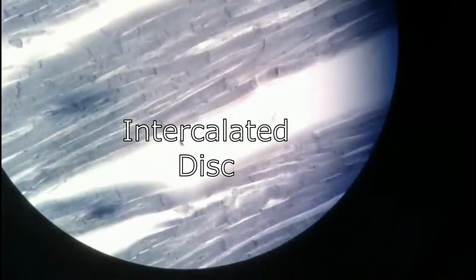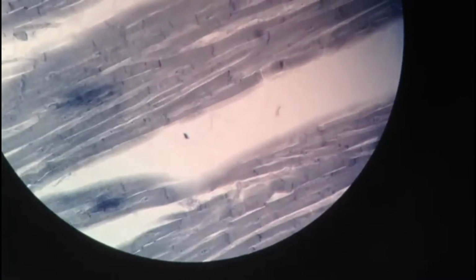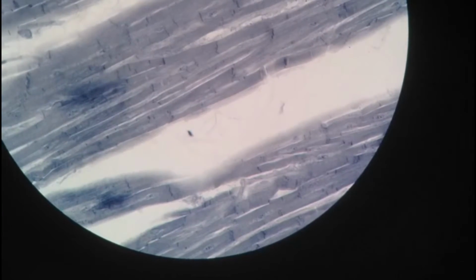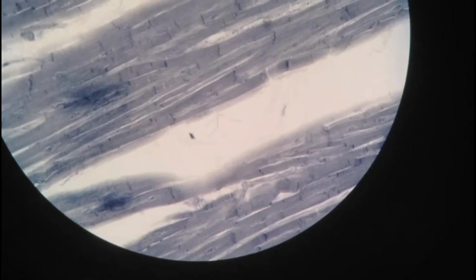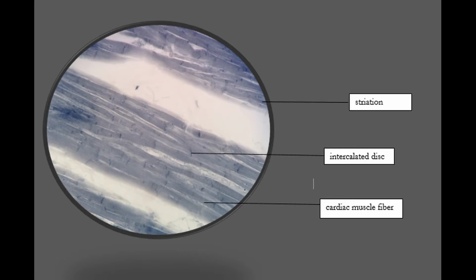Okay, this is the slide in which we can observe the intercalated discs of the cardiac muscle tissue. Okay, intercalated discs are microscopic identifying features of cardiac muscle. Cardiac muscle consists of individual heart muscle cells connected by intercalated discs to work as a functional organ or syncytium. Okay, the function of the intercalated disc is to support synchronized contraction of cardiac tissue.